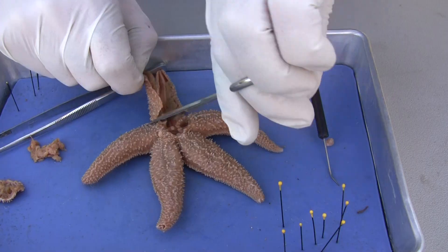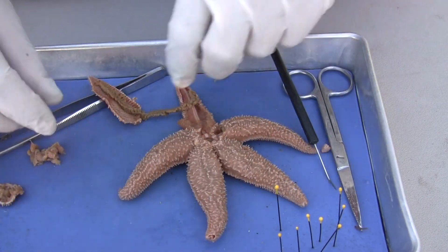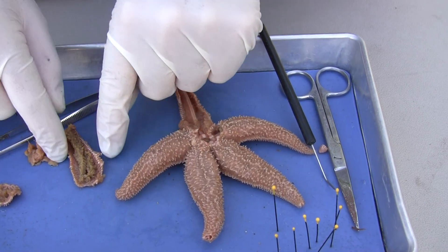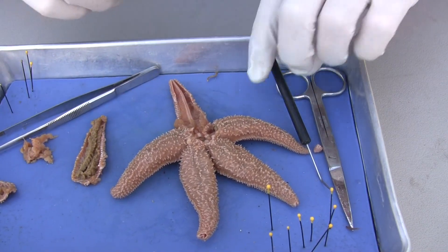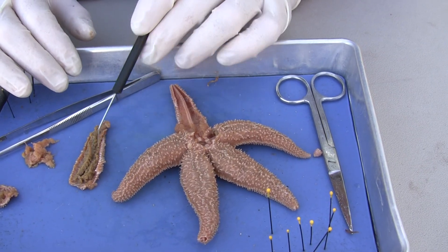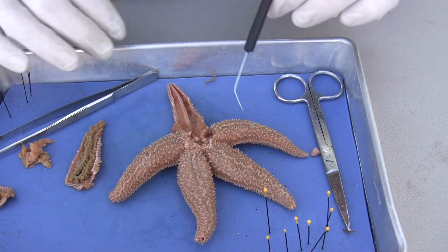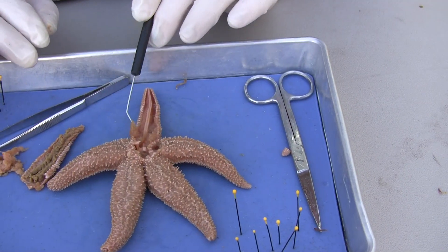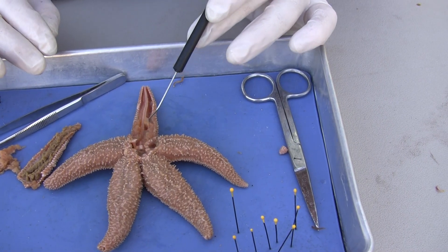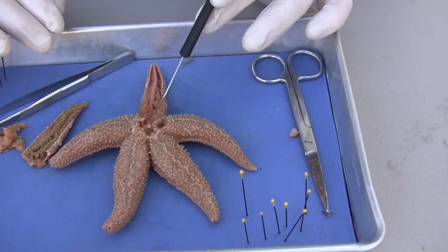And in each of the rays you're going to have digestive gland — it's a really cool looking gland right there. I'm going to set it to the side. And that's what's going to release enzymes to help break down its food, the clam. That's a beautiful organ there. And then all of this is gonads — eggs that are starting to develop. So all this is eggs, eggs all along here.